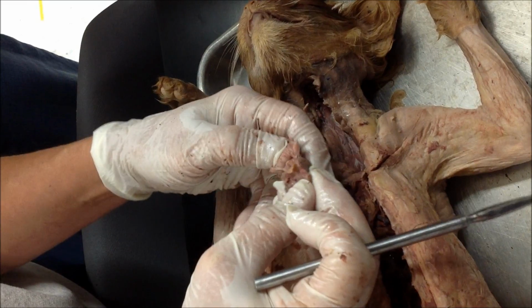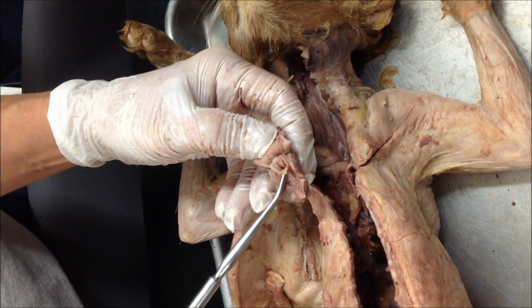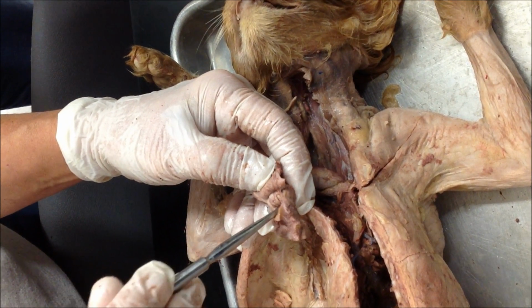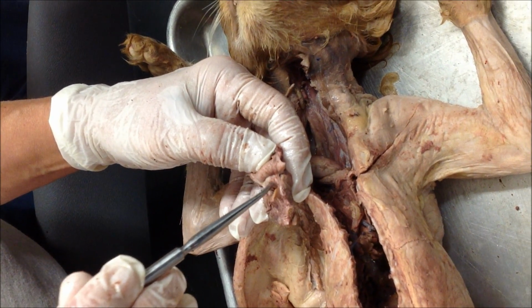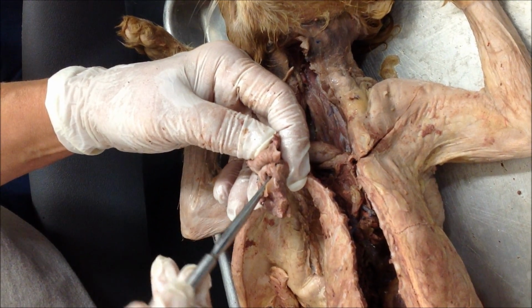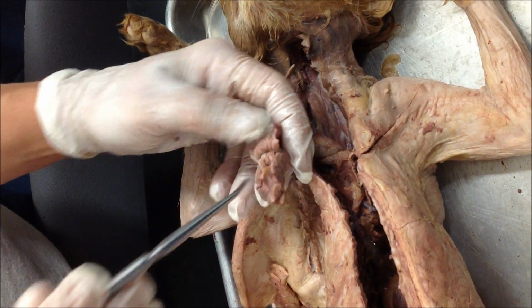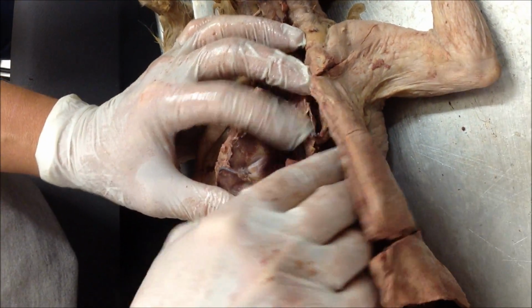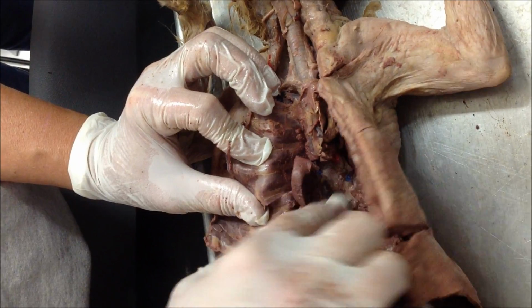When you pull this open this way, you can see the flap, which is the epiglottis, and the hole is the glottis. The upper folds are going to be the doorway folds, so they're vestibular. The bottom ones below that are going to be vocal, vocal folds. Okay, so then we're going to go down, and we have lungs, right?